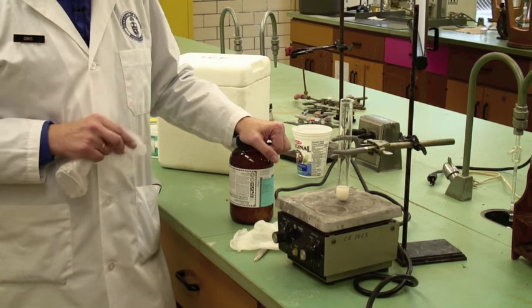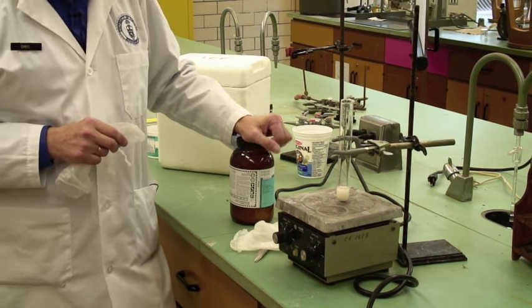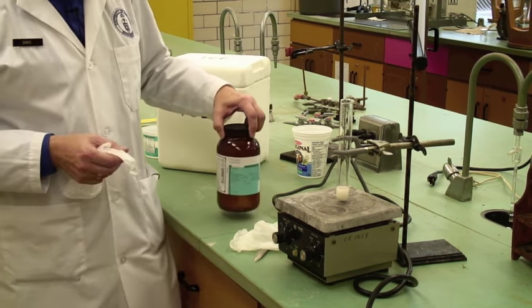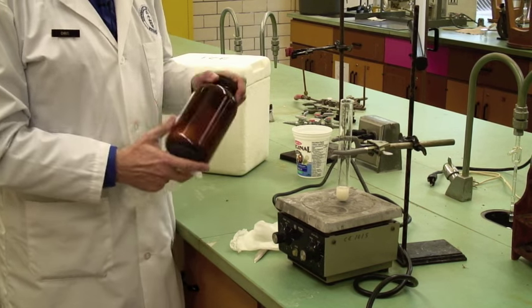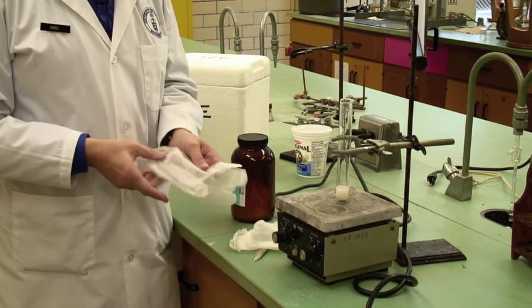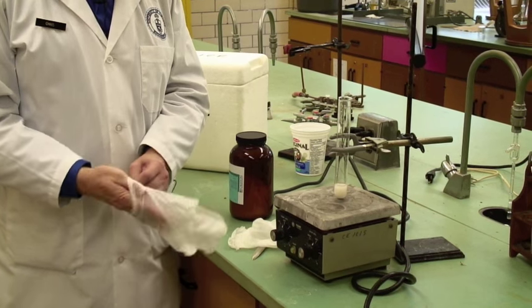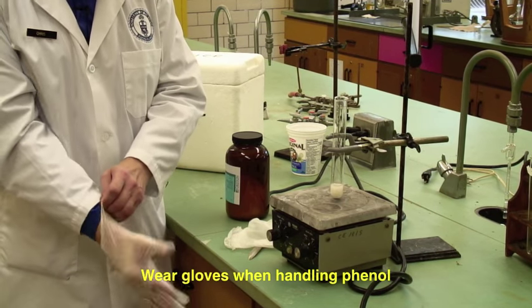The equilibrium you're investigating is phenol and water. I've got some phenol in the jar here. It's a crystalline solid. This is one of the experiments we really do insist that you wear gloves for.